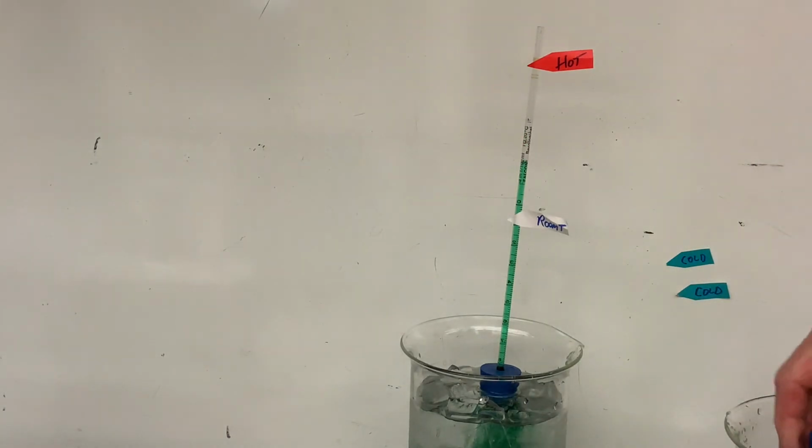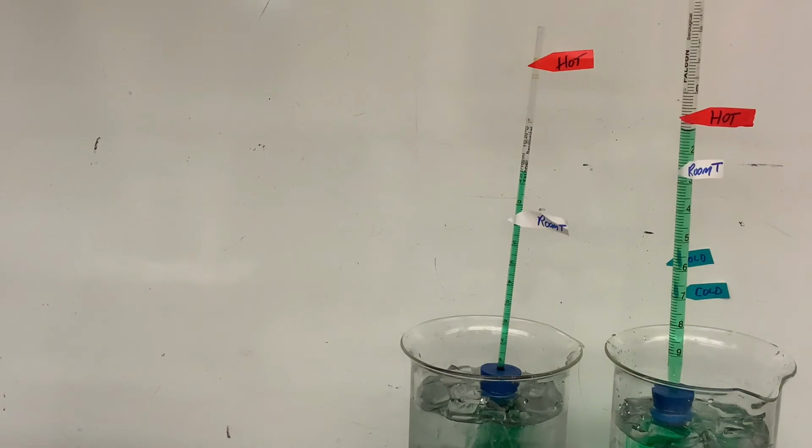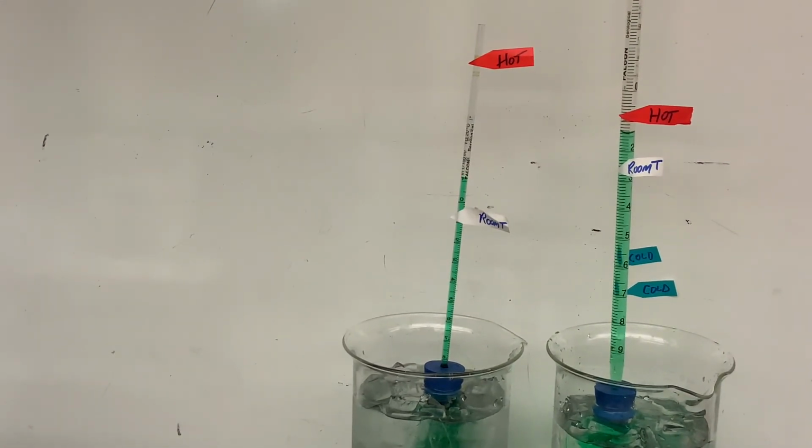Now I will change to fast speed and a time lapse and put the larger tube into the ice water. Again, apologize, feel free to put the video on fast speed. You can see that the dropping is happening a little bit faster because I did speed the video up already.